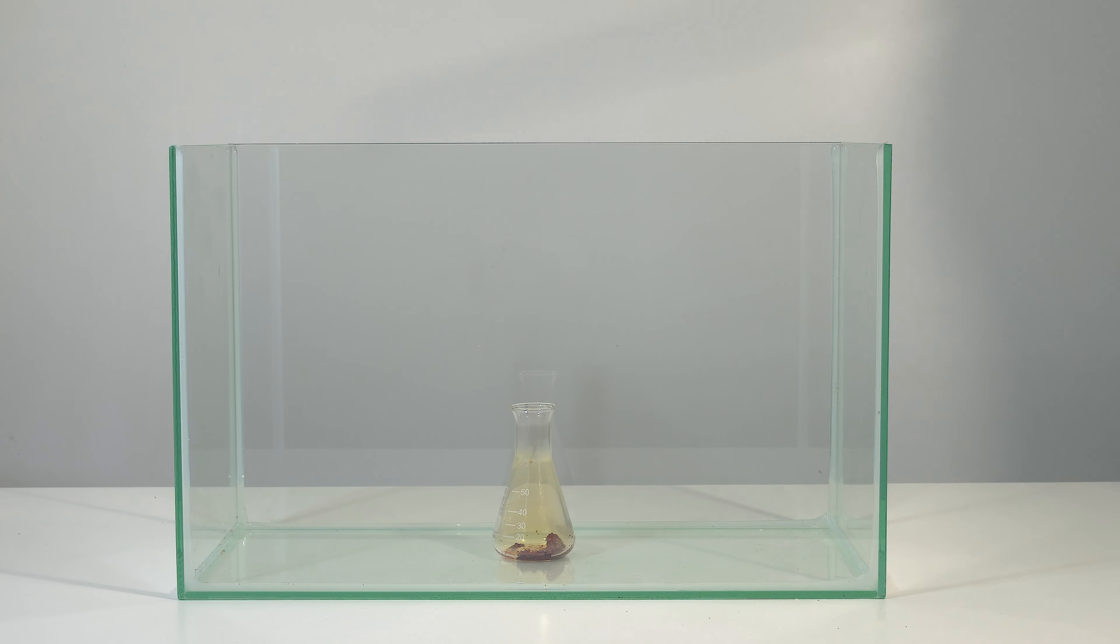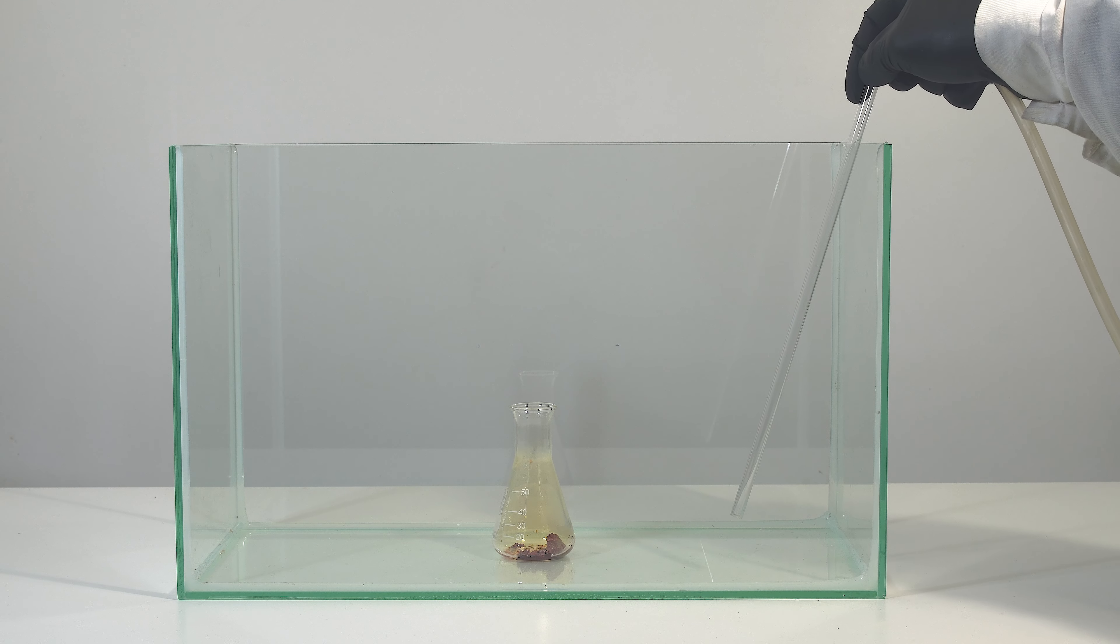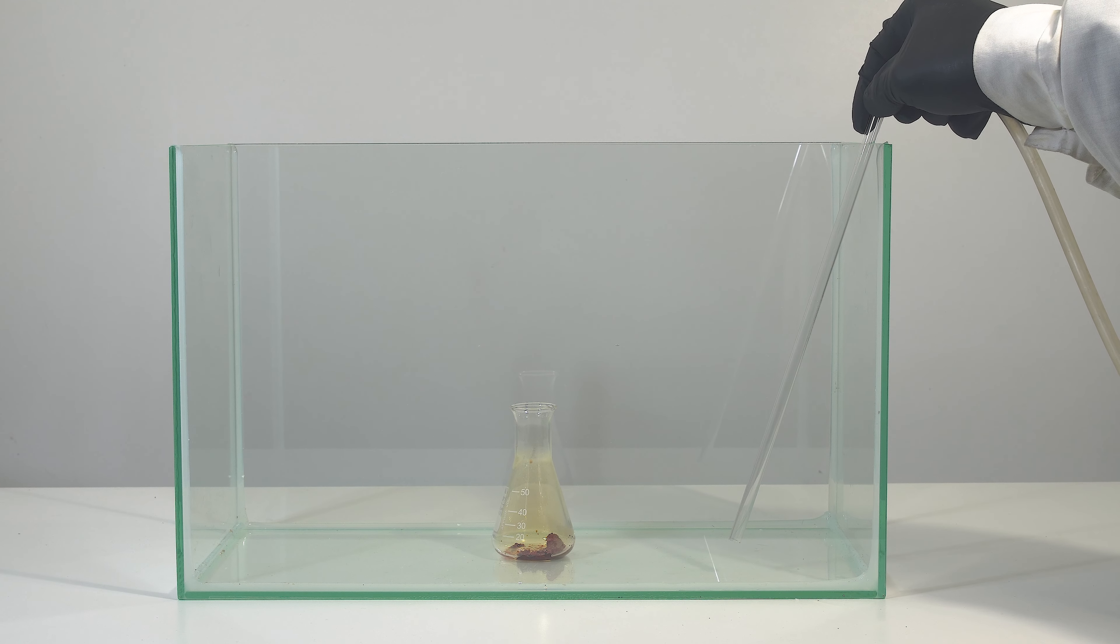So I placed the flask with iodine trichloride in a glass box, and I am filling it with the heavy gas.